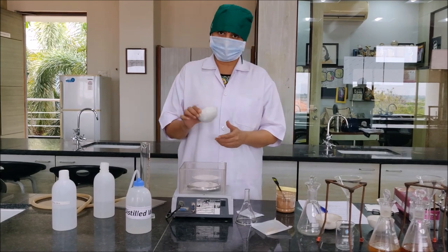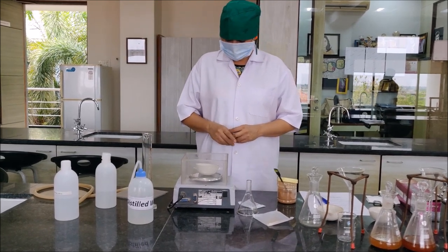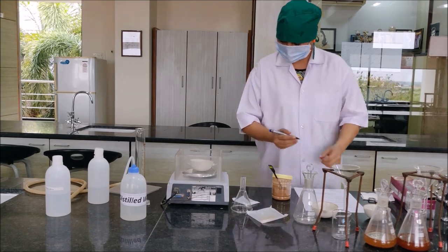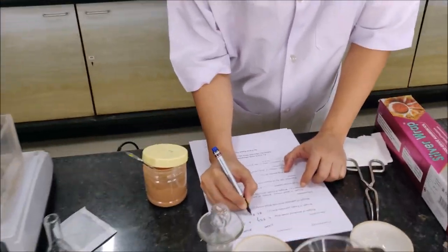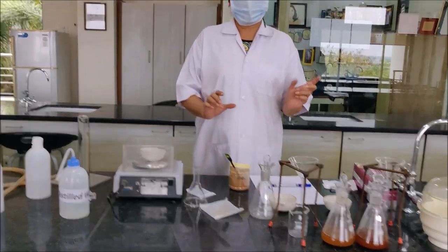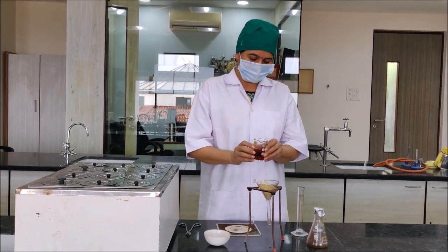While the filtration is going on, we will weigh the clean empty porcelain dish. We will note the weight — it is 80.86 grams. And now we are going to use this empty porcelain dish to collect our filtrate. As you can see, the filtration is completed and we have the extract with us.